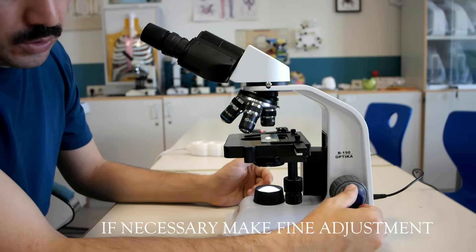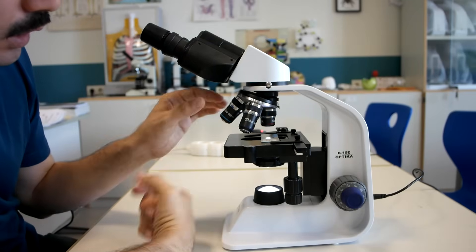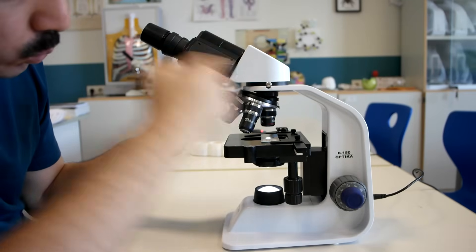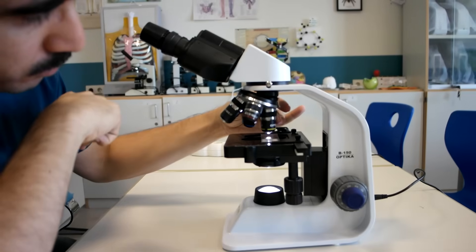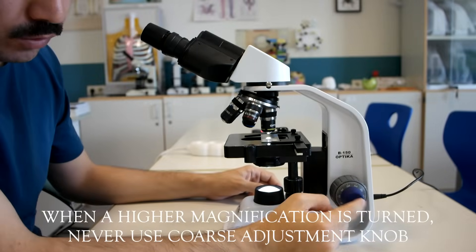Then we use the fine adjustment knob as well. Whenever we need to turn to a higher magnification, we rotate. We never use the coarse adjustment knob anymore, just the fine adjustment knob.